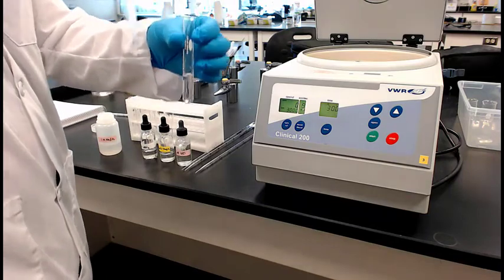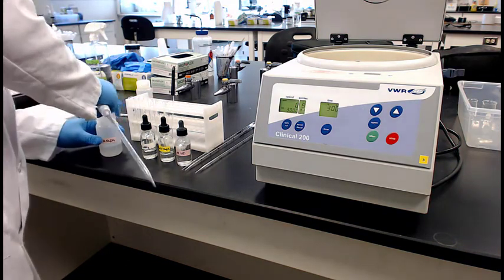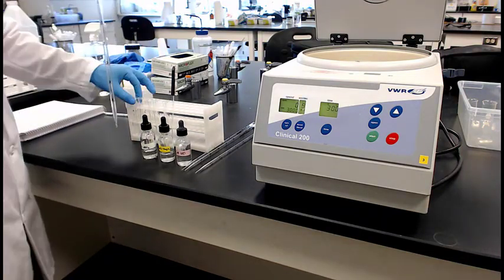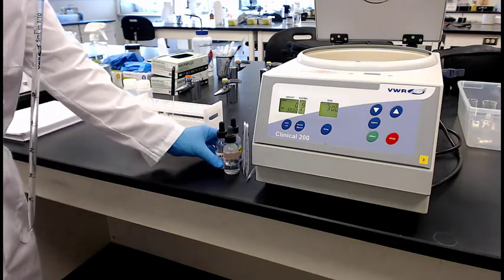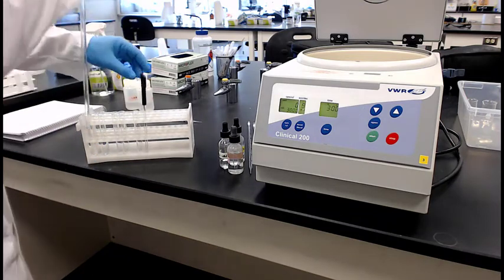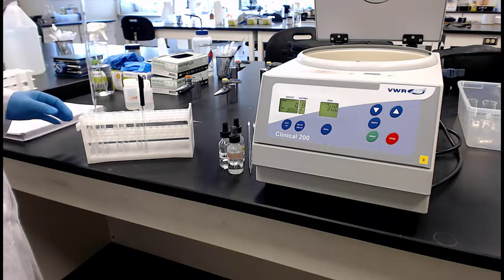You can also observe this. And we'll see if he lets us see it, but it's a very clear solution as well. So they're both clear solutions. So what he's going to do is draw one up and put it in the other tube, because you're supposed to mix them together, right? So he's going to just pull it over and put it in the other tube. So he's mixing the 2 tubes together.